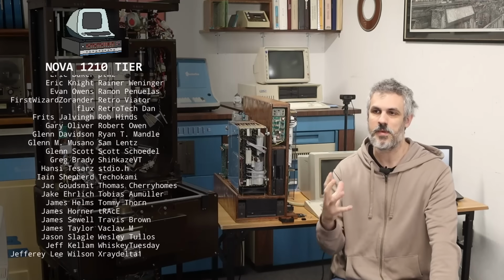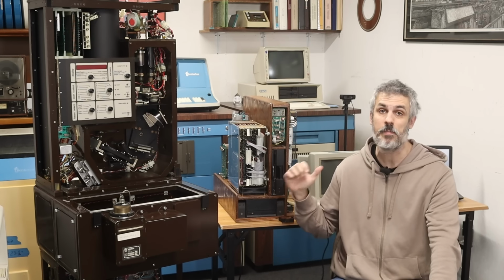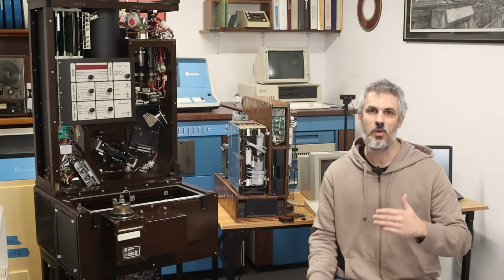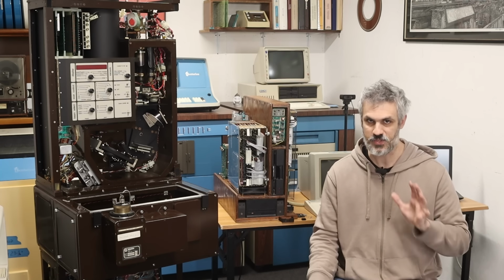So my first thought was maybe it's a power sequencing thing. So I turned the Bomem off, I turned the PDP-11/73 on, got it fully powered up, and then turned the Bomem on, but same story. Straight into mode 2, power cycling like crazy at random intervals. Really unhealthy stuff and kind of terrifying.